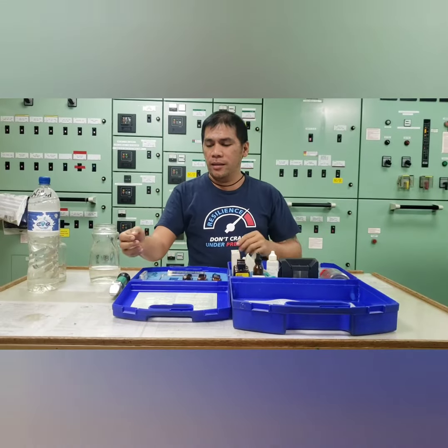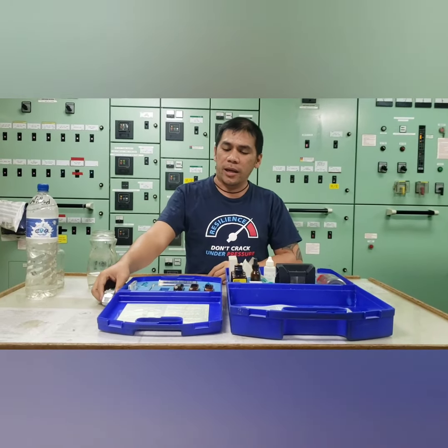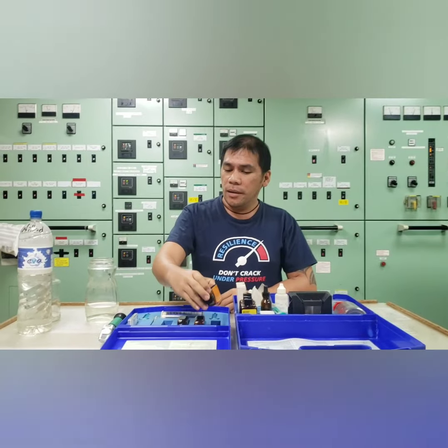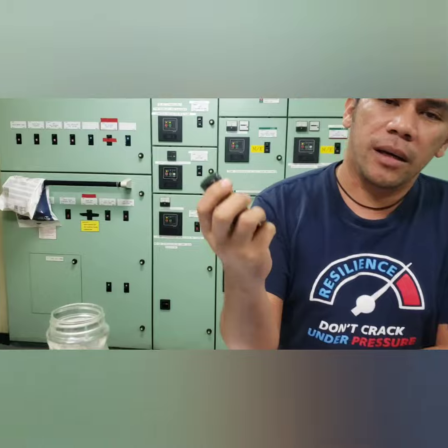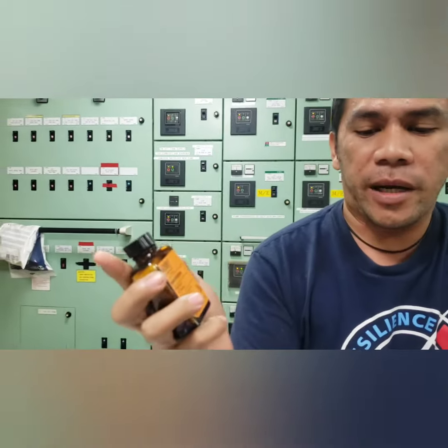So another set of our testing kits is for our jacket cooling system, which is the jacket cooling water. For this time, I will show you the chemical used to determine the nitrite content of your jacket water.